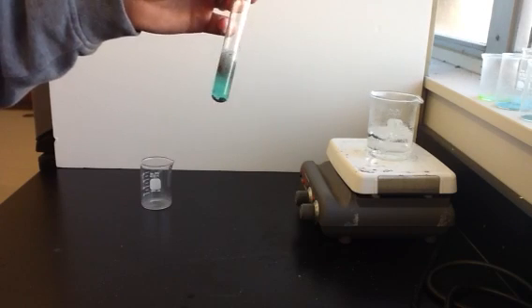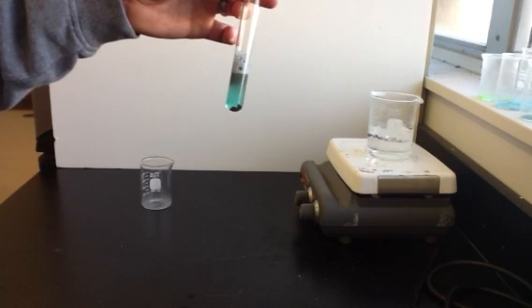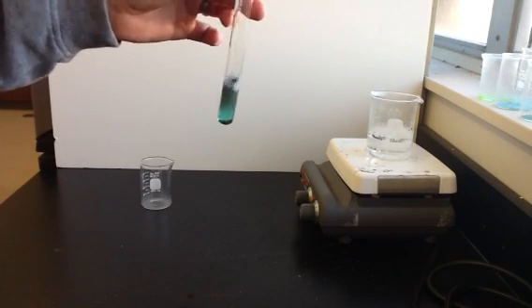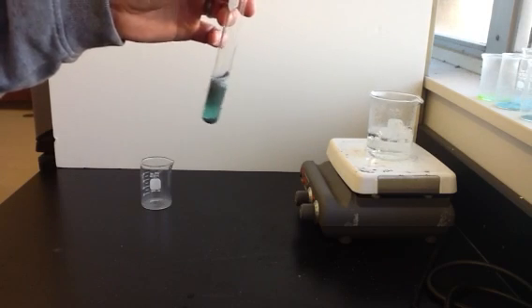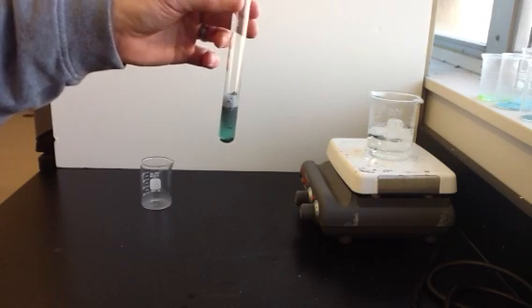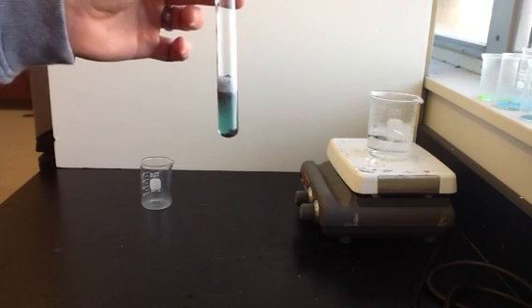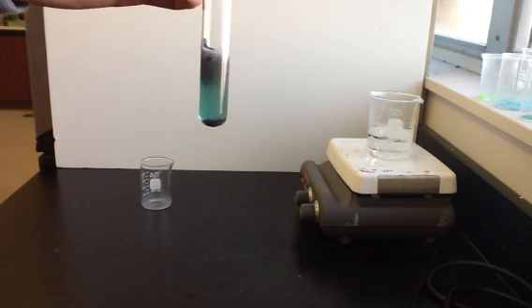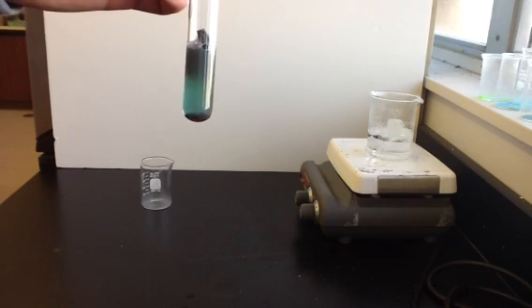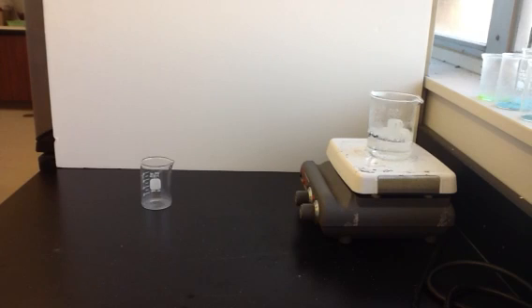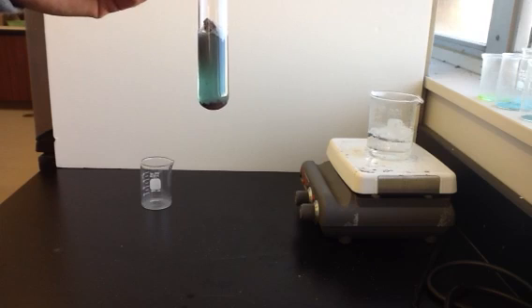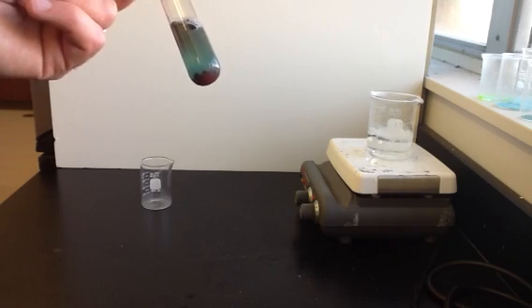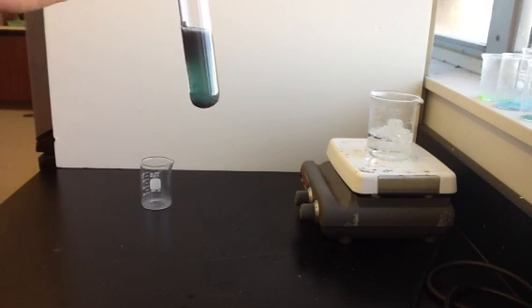And we should see that we get the same amount of copper that we started with. So we've taken copper through a series of reactions. We didn't produce copper. We didn't destroy the copper that we started with. It just changed form several times. And now we're making the copper back into a solid. So the aluminum metal is now going into the solution. And then the copper is becoming a solid and it's settling down to the bottom. And in the end, we should have the same amount of copper that we started with. If we started with one gram of copper, we should still have one gram of copper at the end. We didn't create or destroy any copper. It just changed into several different forms.